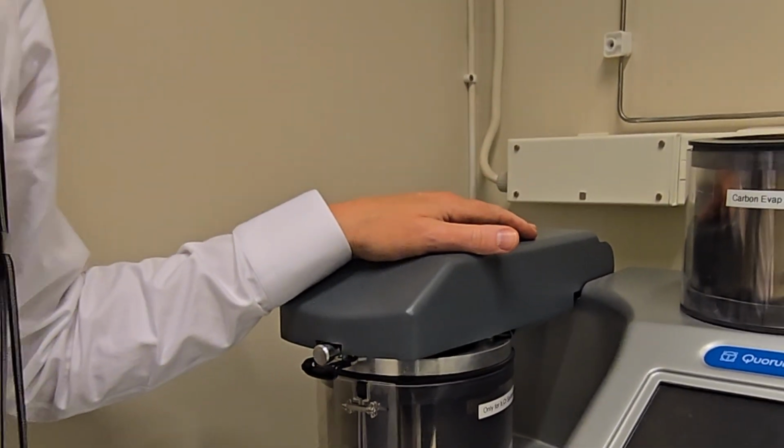And the thing is like this. There can be many reasons. In the old days, we always coated the samples with gold because gold has excellent electrical conductivity. The drawback is if you're going to do high resolution work, like in modern electron microscopy, when gold is sputtered onto the surface, it forms small droplets, and then you will see these droplets. If you want to make very thin coatings, which is needed in high resolution microscopy, you need to use a metal that doesn't form drops. Iridium is the best metal for that. With iridium, you can make the thinnest coatings for the best performance.